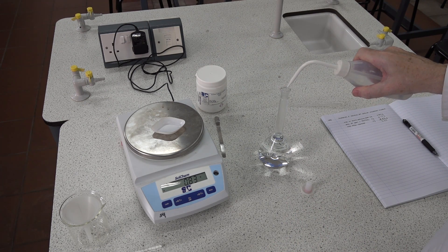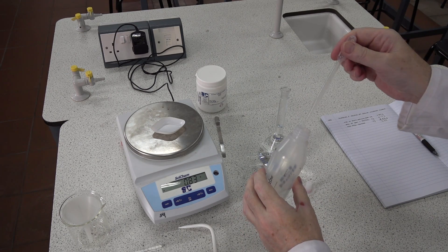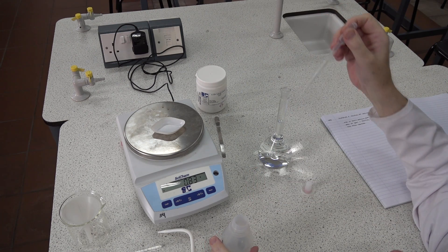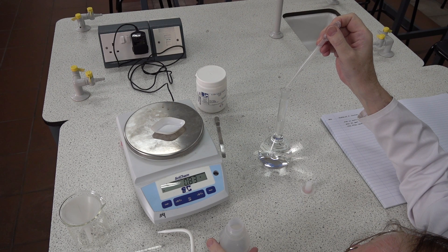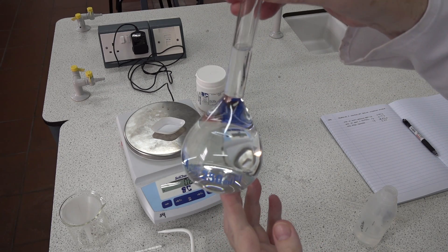At this point we need to be aware of overshooting the mark. Add a little bit more with the bottle, but when we get close we use a dropping pipette for greater control. Lower your head down in line with the flask and add water drop-wise, approaching the line, then a few drops at the end, keeping your eyes level with the bottom of the meniscus and the line on the flask.